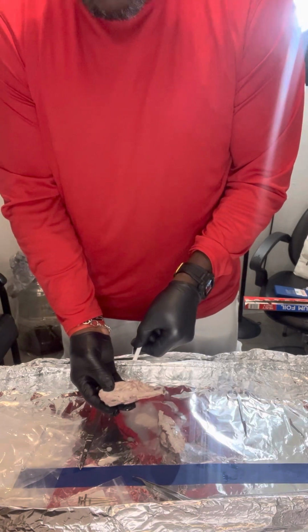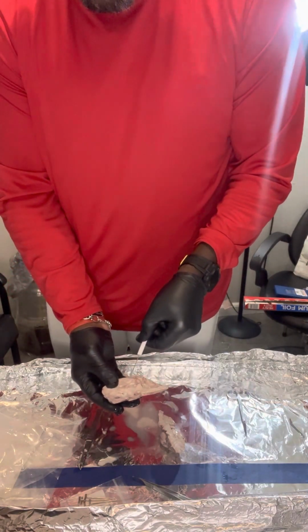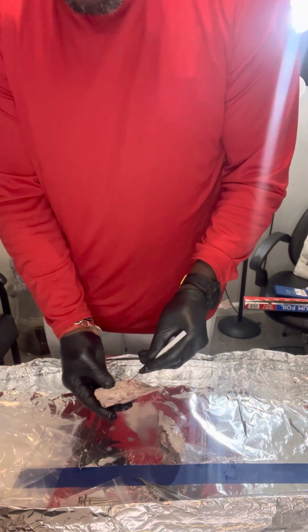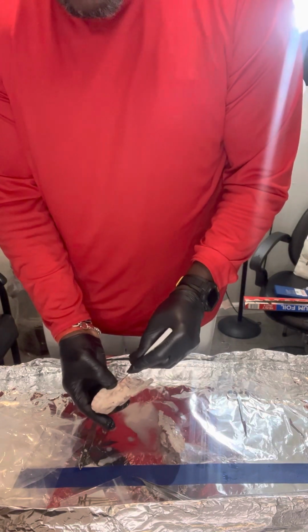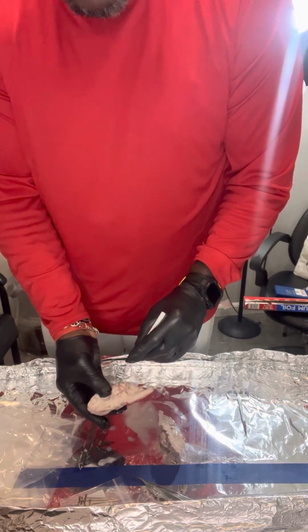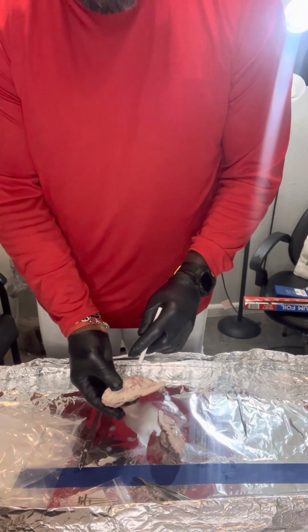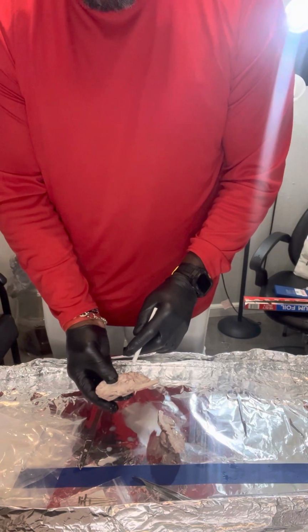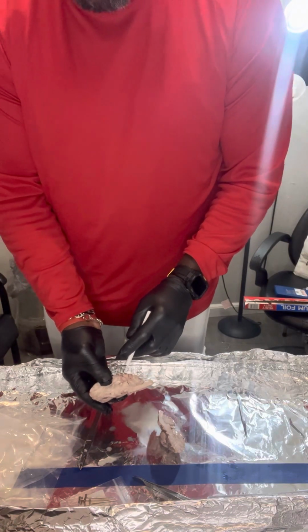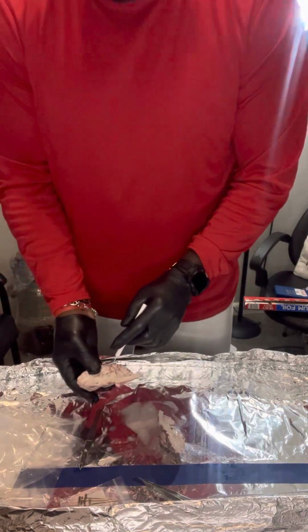The second area I'm going to identify, I believe, is going to be the pons, which is somewhere in this region here. Open that up a little bit. That's the pons there. The pons is a part of the brain structure that links your brain to the spinal cord and handles, I think, the unconscious processes and jobs.